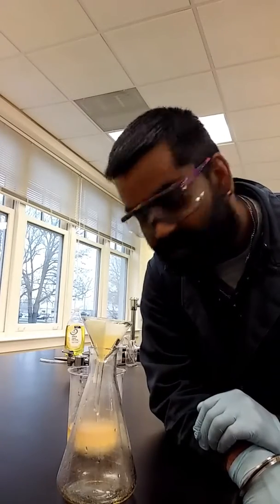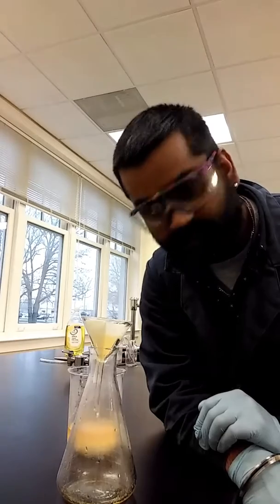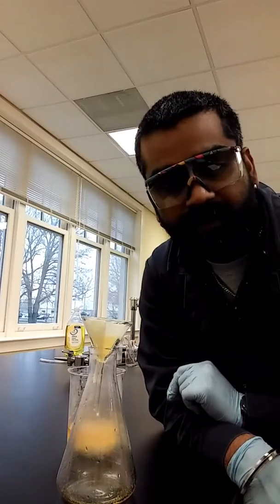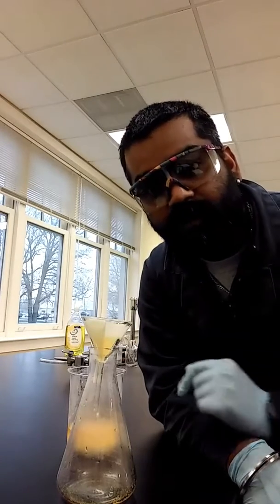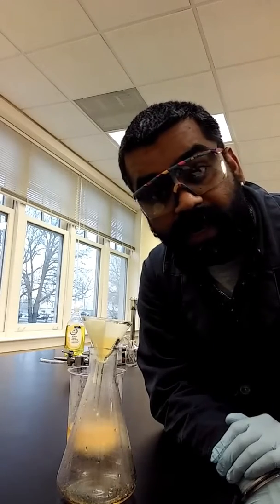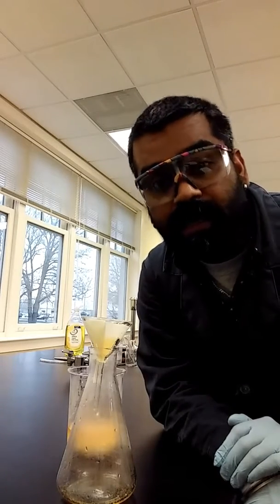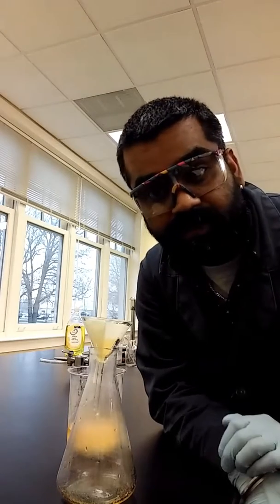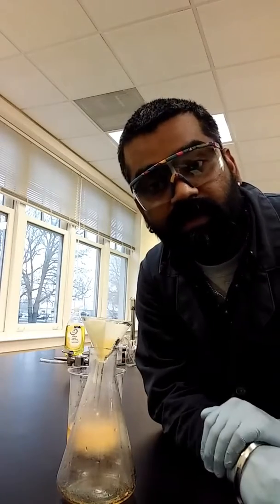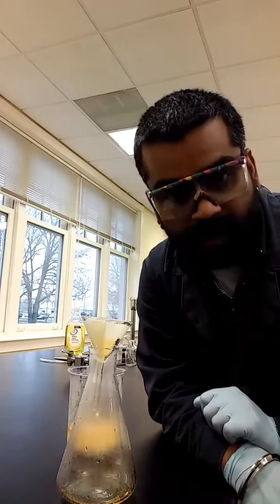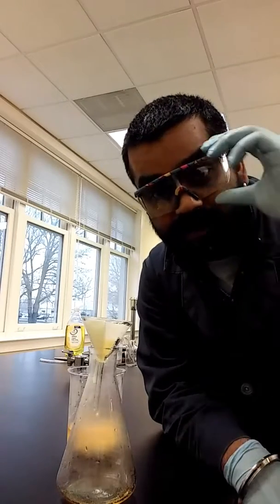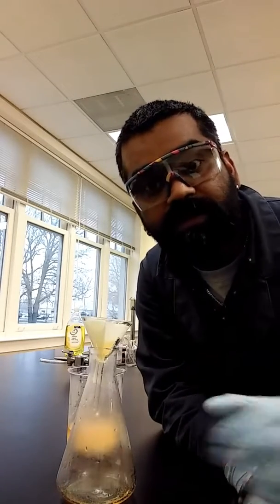Well, do you want me to actually stand and show you the whole video? No. Okay. We're just going to filter, separate the liquid layer from the solid layer. And then we're going to use the solid further into our step four where we add concentrated sulfuric acid. It's not the pure form, but we're going to dilute that concentrated sulfuric acid to a more lighter form. And then we're going to use this. The bottom portion, well, you can keep it in a waste beaker and then we can dispose of it later. All right. I'll see you with step four.